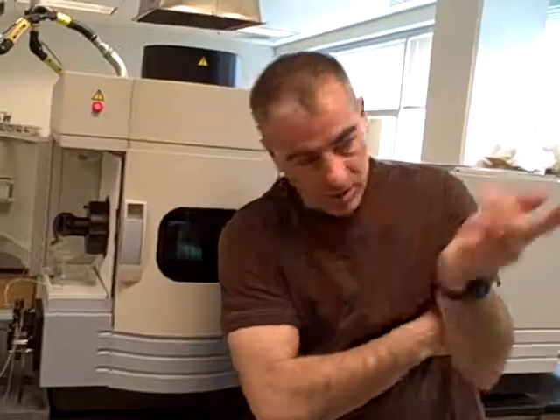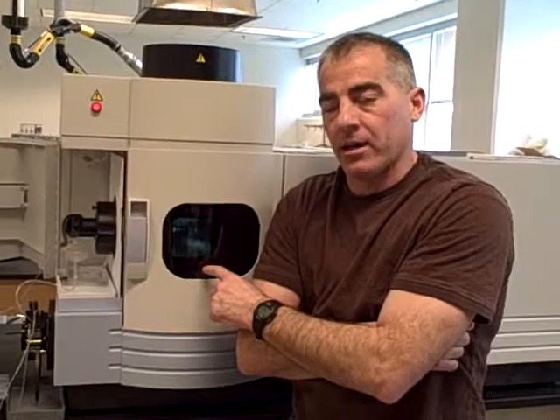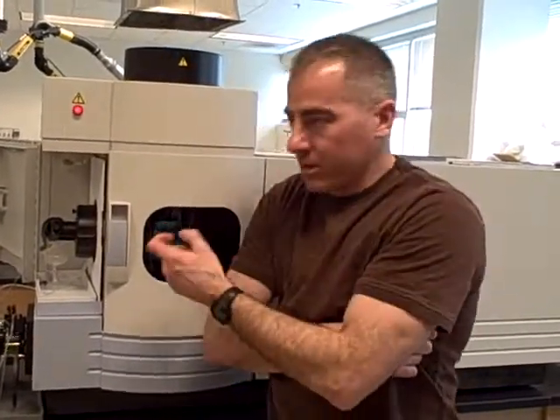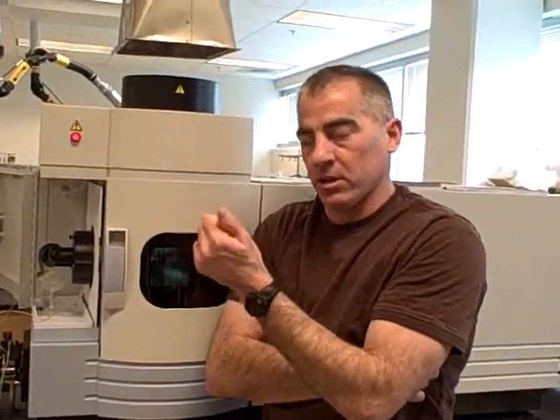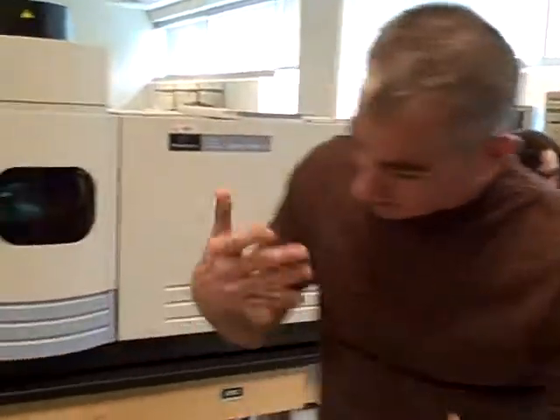Anyways, let's get back to that. That plasma there is an argon plasma, meaning we pump argon gas into an RF, or radio frequency, area. What it does is vibrate the argon molecules to the point where it basically heats them up and they lose most of their electrons. The interior of that plasma is somewhere between 5,000 and 8,000 degrees Kelvin. That's pretty hot, the type of heat you can weld with. But it's contained nicely. The whole design is to keep the quartz tubes around it from melting.